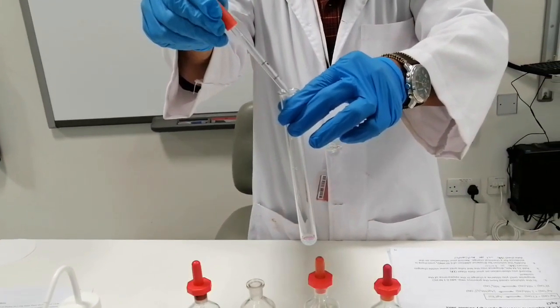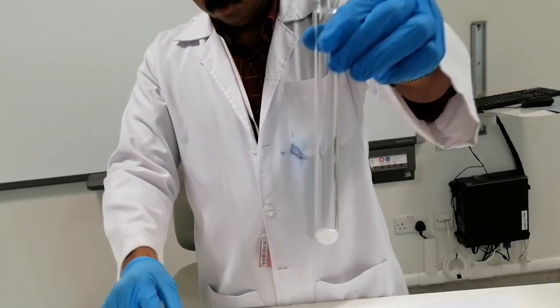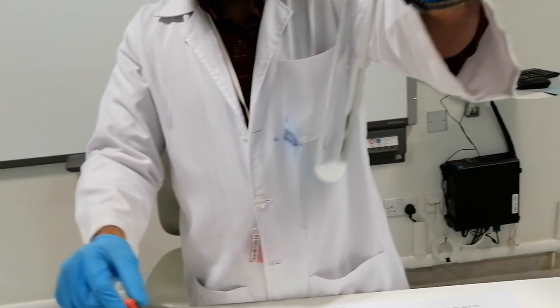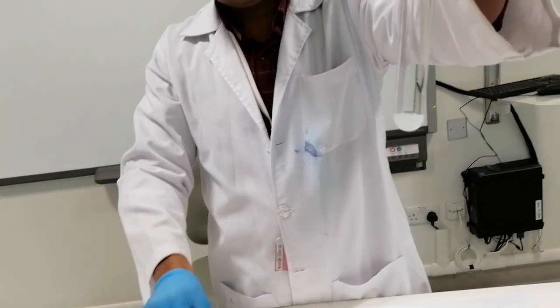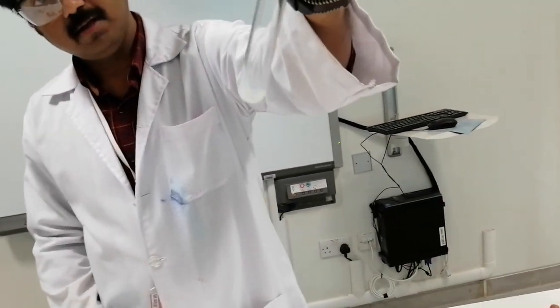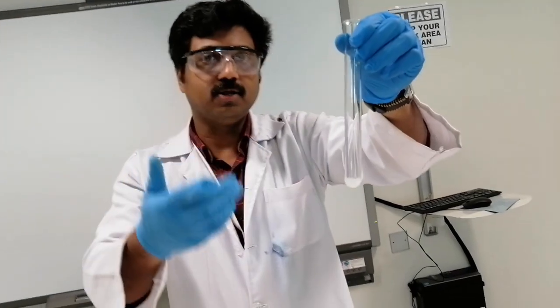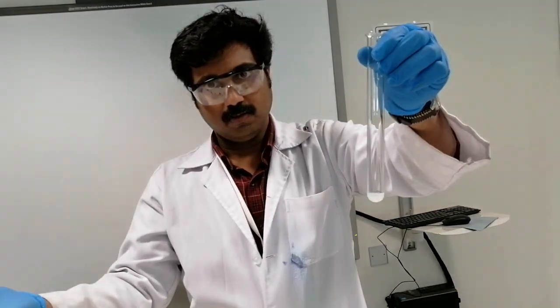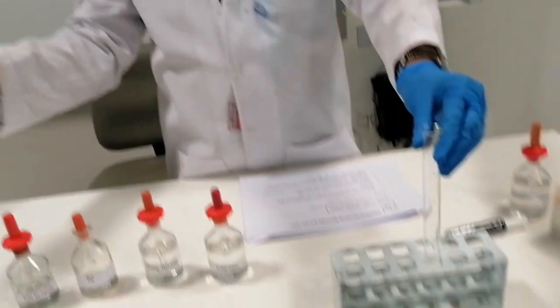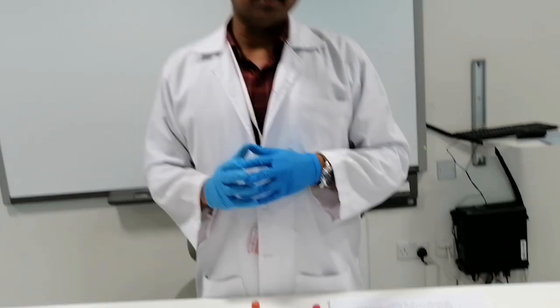After some time, you can see that once you add HCl, we are getting the white silver chloride precipitate. Should be fine. So this is the silver chloride, which is actually a sparingly soluble salt. So in your test tube, we have the equilibrium between silver ions, Cl- ion, and the solid silver chloride. So we're going to leave this one here. Now as the next job, we are going to disturb this equilibrium.